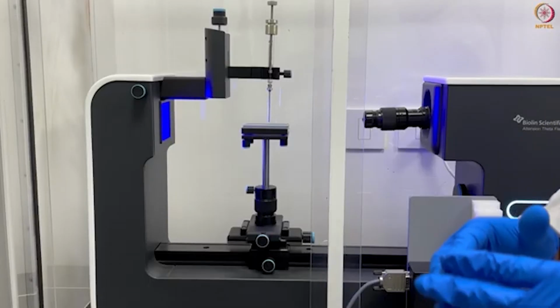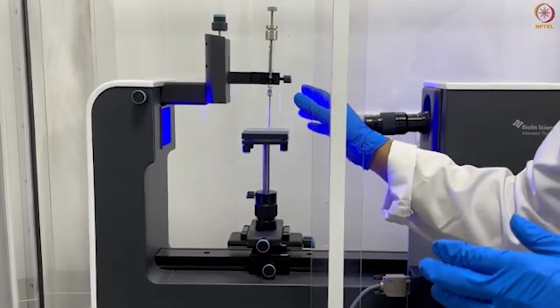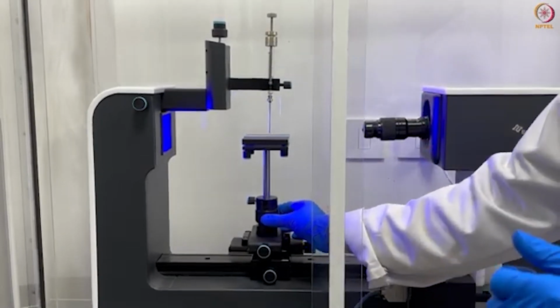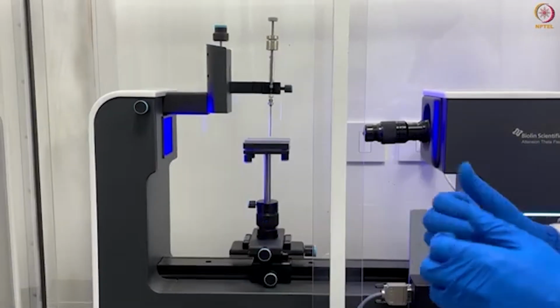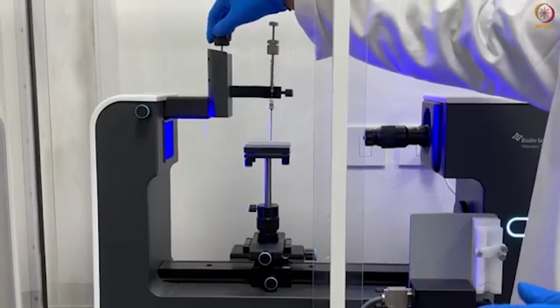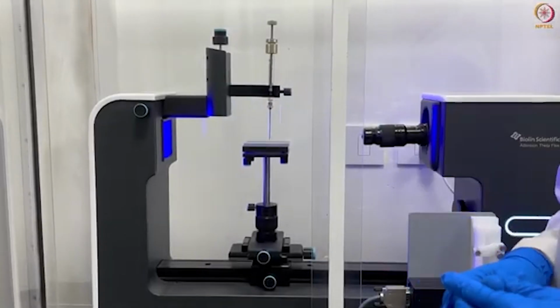Currently, the distance between our substrate or stage and the needle is very high. You can adjust the z-axis using this control. As you can see here, this is moving downward and this is moving upward. You can also adjust the x and y direction of the syringe using this screw so that the droplet will be positioned in the middle of the camera view. Once aligned, let's proceed to sample the droplet.